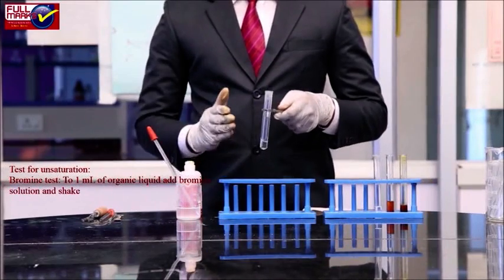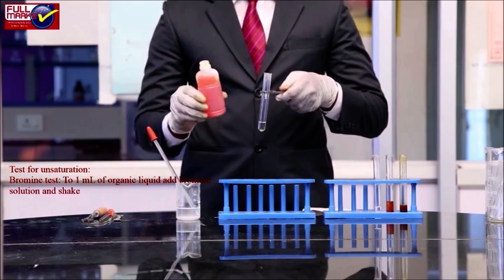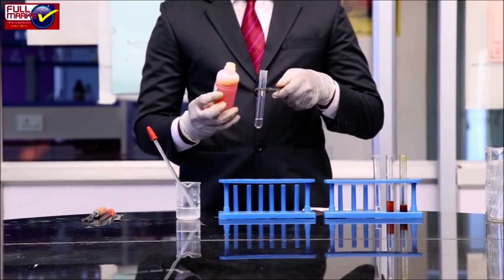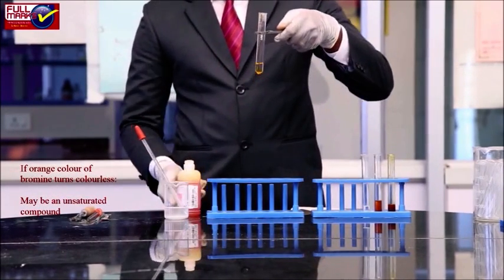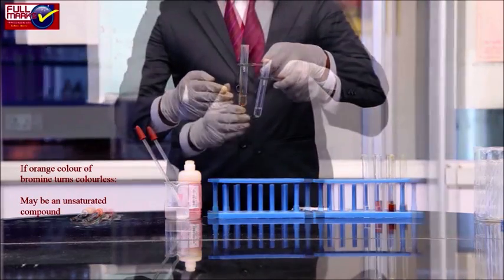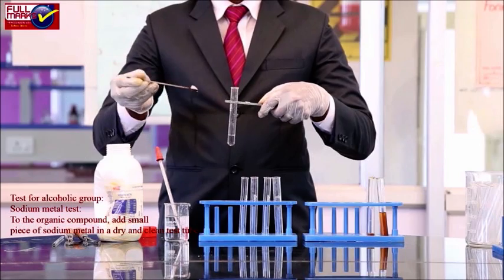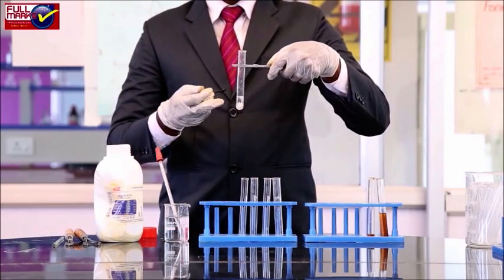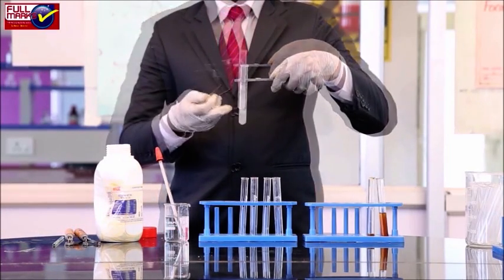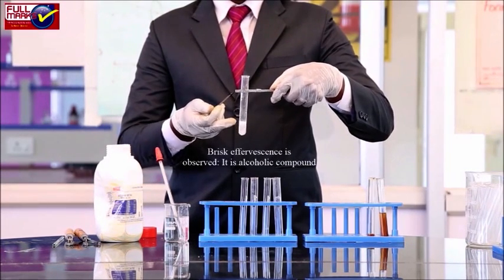Test for unsaturation. Bromine test. To 1 ml of organic liquid, add bromine solution and shake. If we observe the orange color of bromine turns colorless, it may be an unsaturated compound. Test for alcoholic group. Sodium metal test. To the organic compound, add a small piece of sodium metal in a dry and clean test tube and heat. If we observe a brisk effervescence, it is an alcoholic compound.